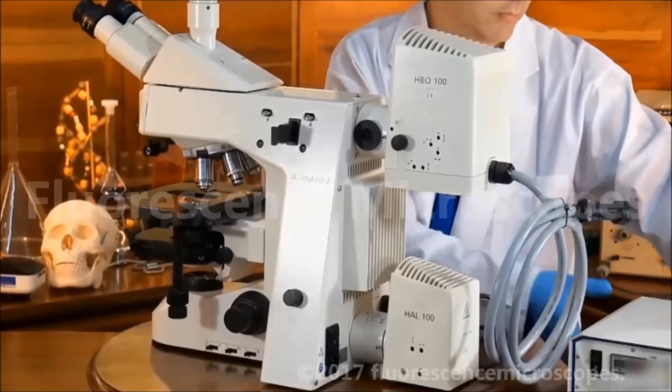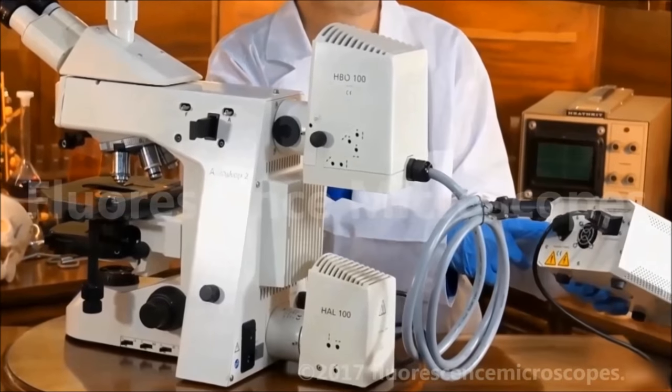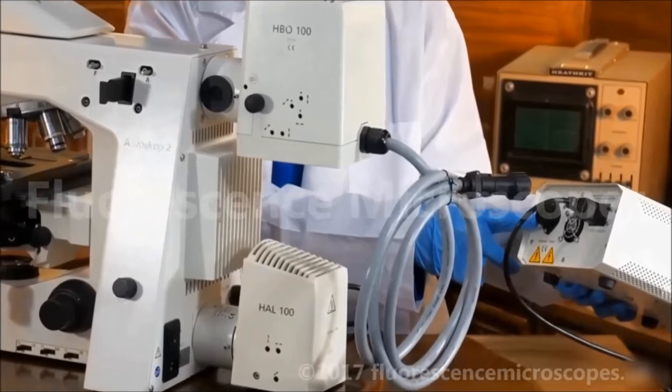This connection goes to the back of the transformer, the power transformer.